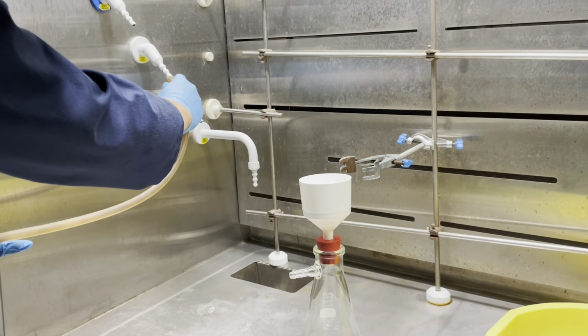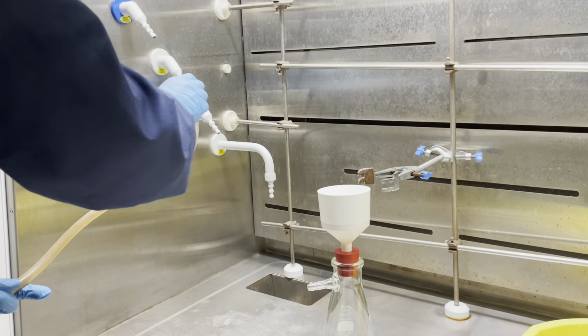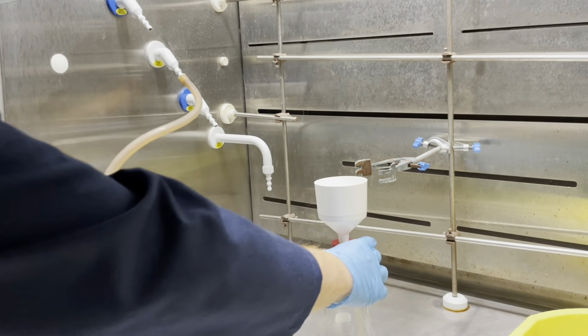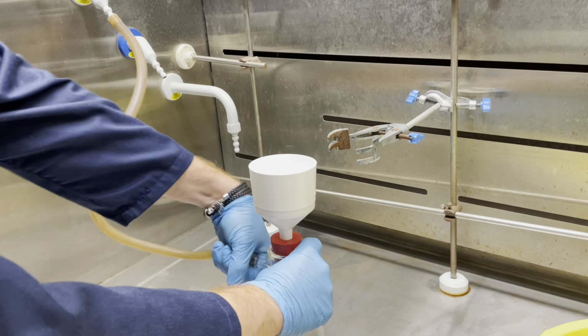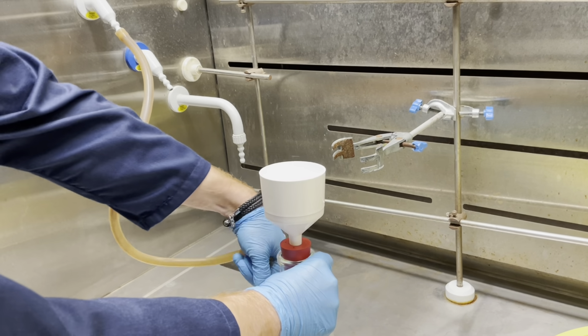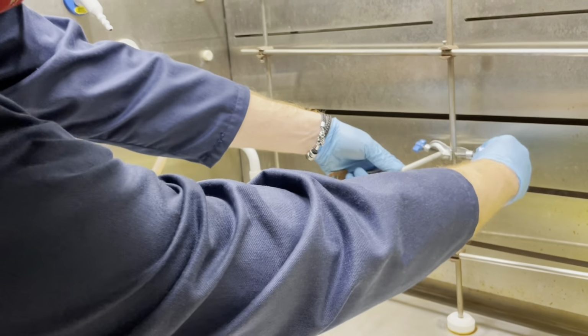We will use vacuum filtration to wash and dry our product, and this involves a Buchner funnel. You will first connect your Buchner funnel to the vacuum using a pipe as illustrated here, and you need to remember to clamp your Buchner funnel to the back of the fume hood as well.